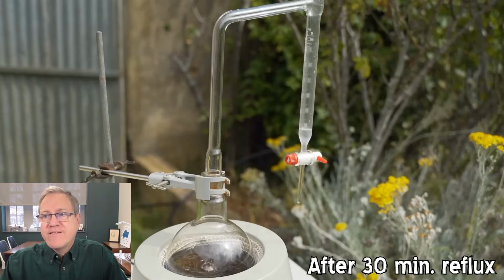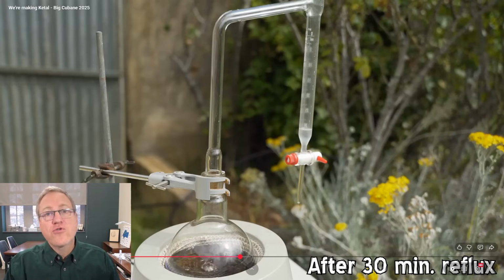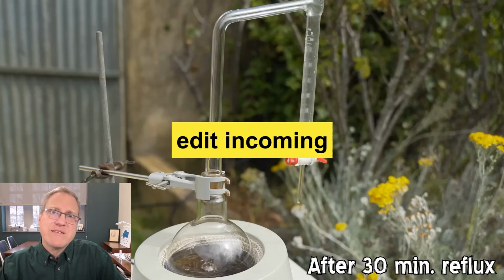And note he has this setup to the right. We have this tube, and there's some liquid in that tube. This is called a Dean-Stark trap. We'll go into more detail about the Dean-Stark trap when we start running the reaction. But I suspect he's doing two things here. One, and he explicitly states this, that he's trying to let some tars form in the toluene so he can get rid of those before he starts his reaction. And two, I think some of that drain cleaner might not be pure sulfuric acid. It might have some water in it. So this gives him a chance to remove some of the water from that sulfuric acid, because the excess water, he wants to minimize that water in his reaction.